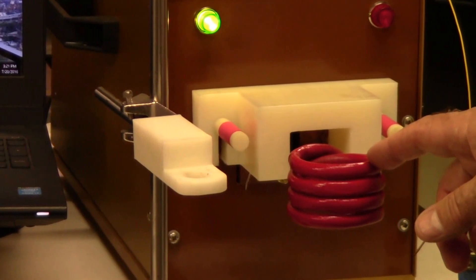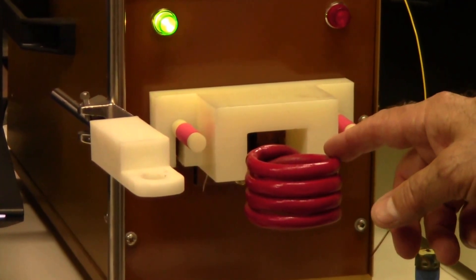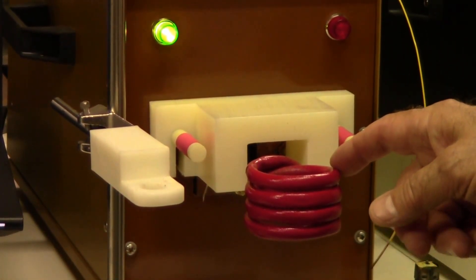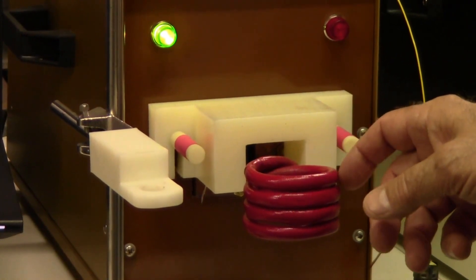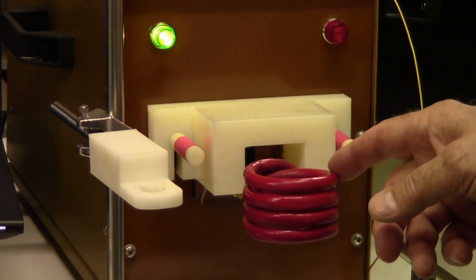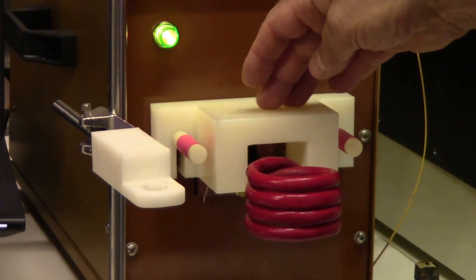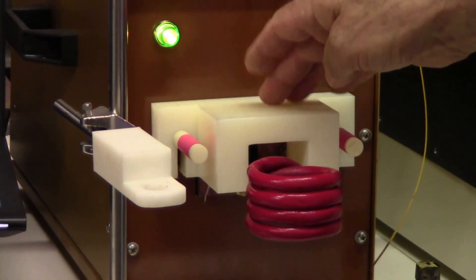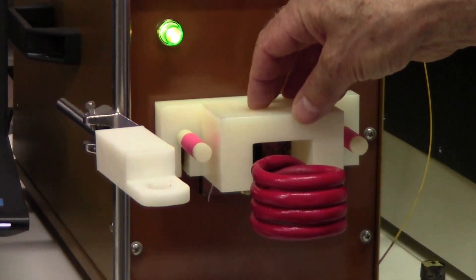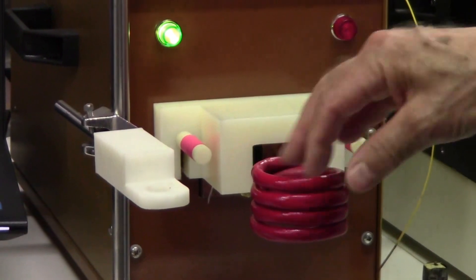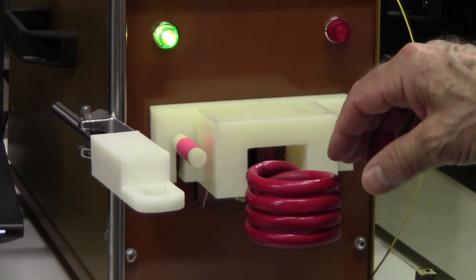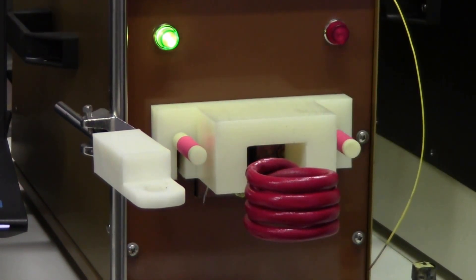The heating coil itself is designed with safety in mind. It's coated with a fiberglass sheath, and then it's dipped in a lacquer, electrical lacquer. And then to protect the connections to the heat station, we have this nylon cover. So there is nothing that you can touch that's electrically active when we're hot. So that pretty much concludes our demonstration.